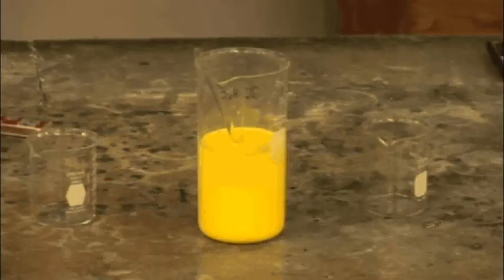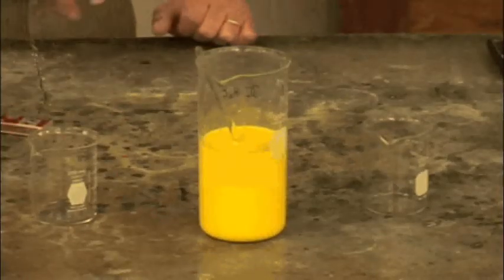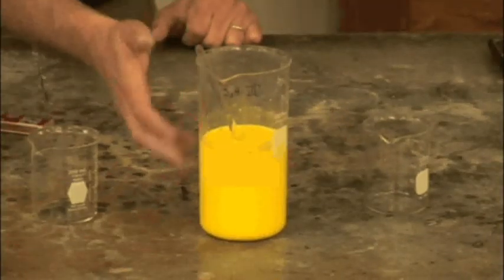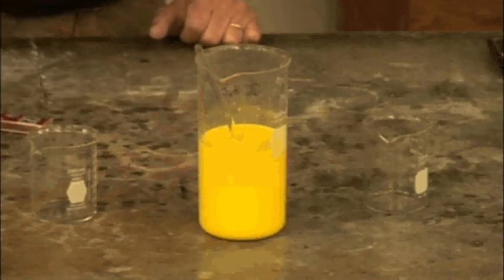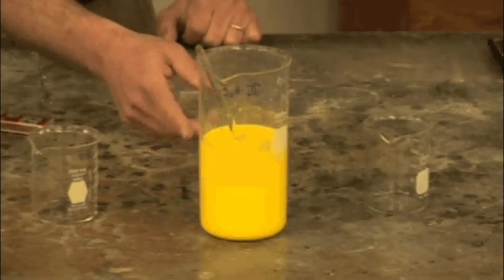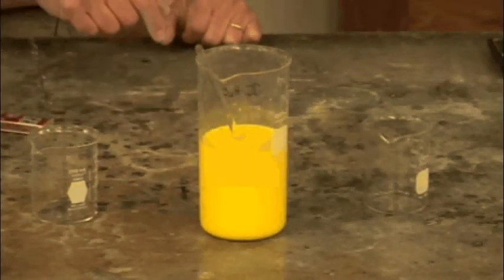We have ourselves a yellow solid, a precipitate, and at the moment it's floating around. It's also extremely heavy. The lead iodide, lead's heavy, iodide's heavy. So it's going to crash down to the bottom of the beaker.